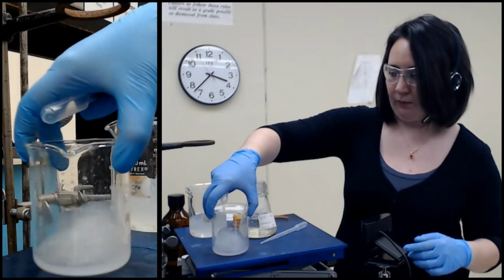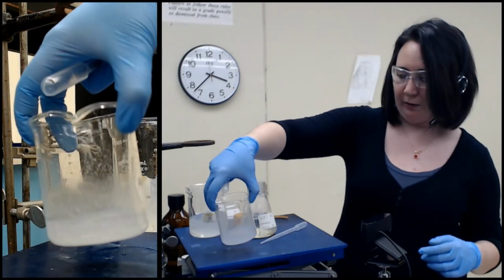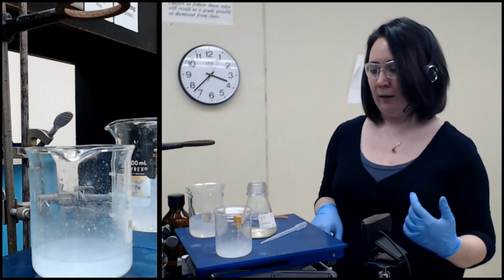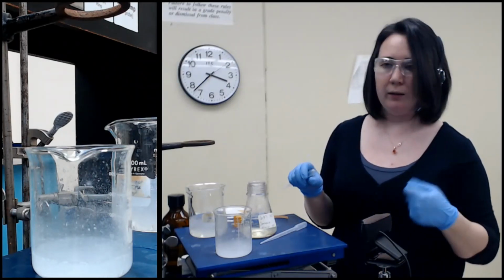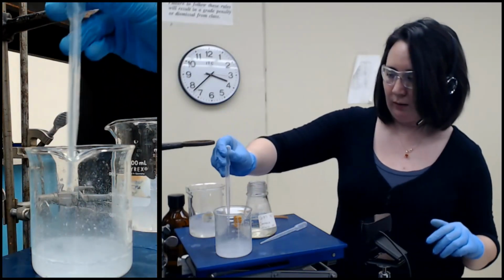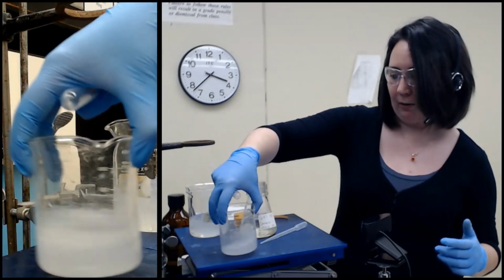See, it's bubbling. You can also see some solid is forming as well. If you were listening to it, it would sound like if you took a bottle of soda and undid the top and poured it out, you hear all the fizzing, same kind of thing. No one's paying me, so I'm not going to drop any product placements here.